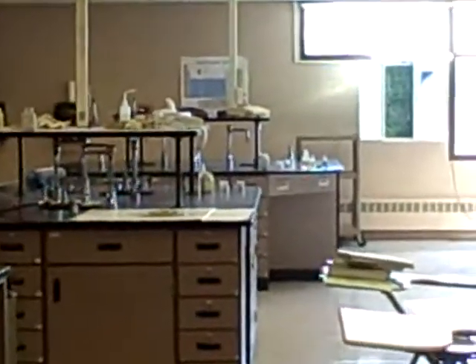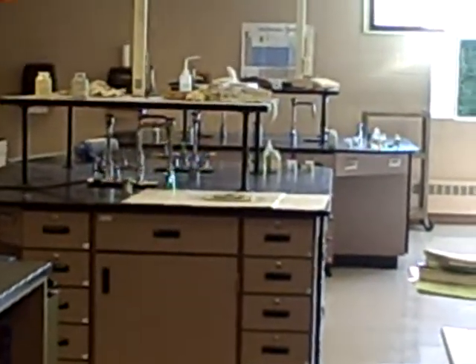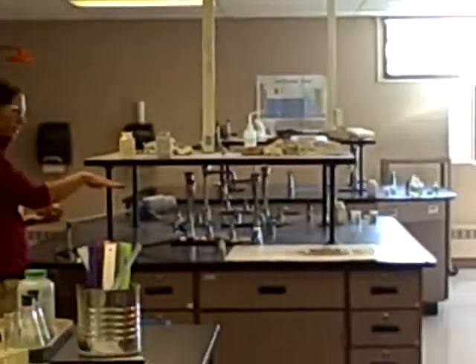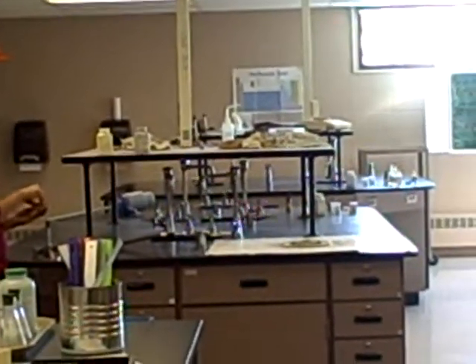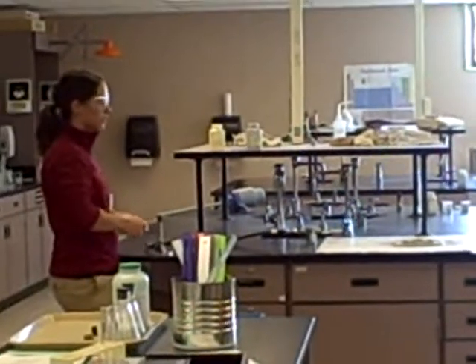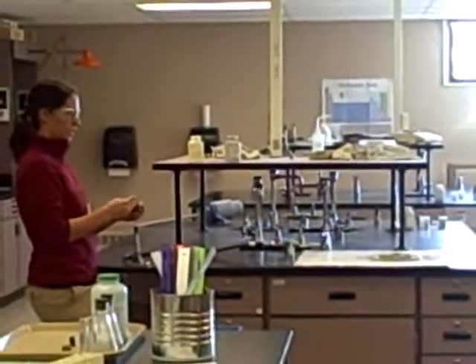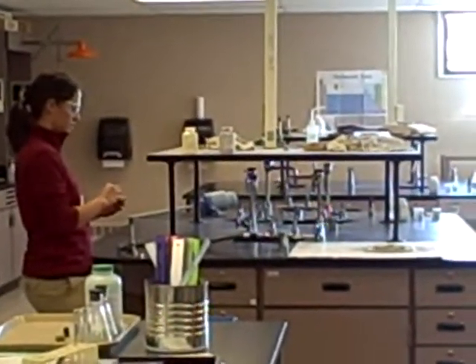Alright, I'm not going that close. Shh, guys. Alright, so we have magnesium. All I'm going to do is light the magnesium. It'll burn down just like a candle wick, and then it will ignite the zinc and sulfur to make the reaction happen. The magnesium burns really bright. Don't look directly at it, because you will see spots. I don't know for how long. Maybe forever. Let's turn off the light.